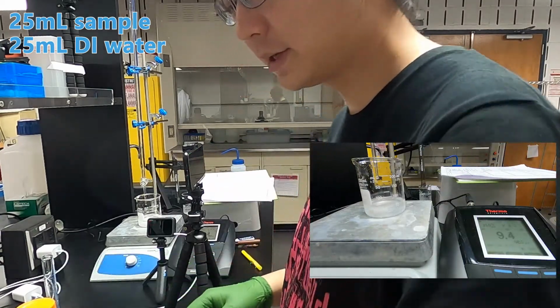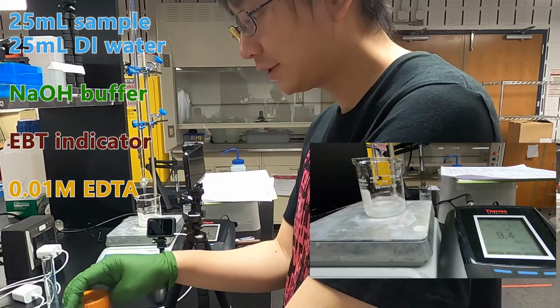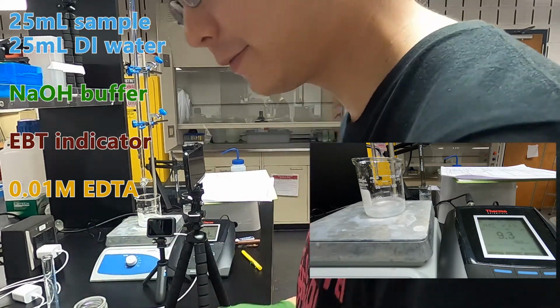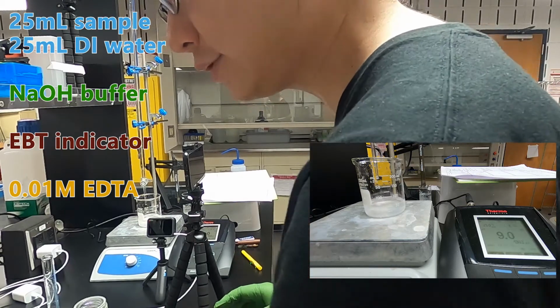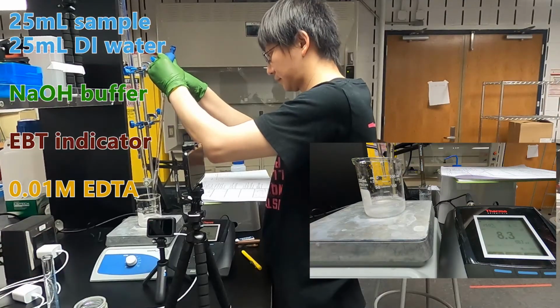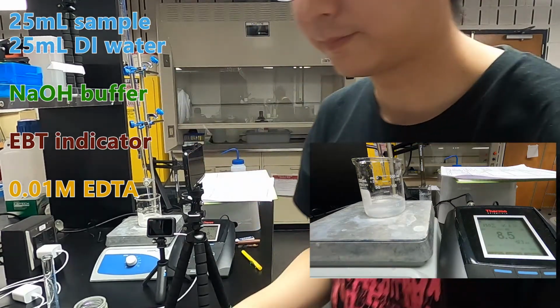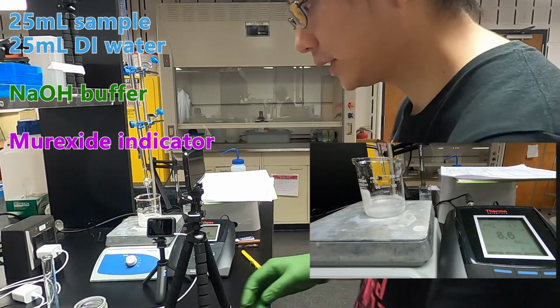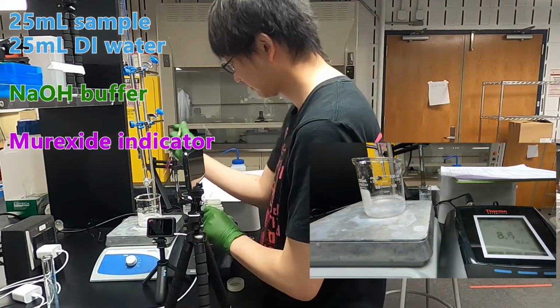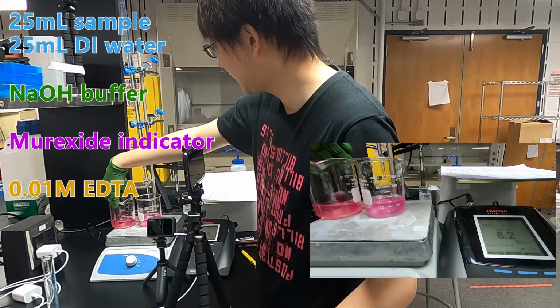Next, we add 10 milliliters of NaOH into the solution, but here I don't have enough sodium hydroxide, so I use potassium hydroxide instead. And then we add the murexide indicator. Now we can titrate with EDTA.